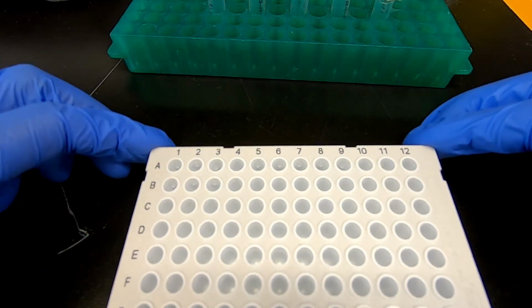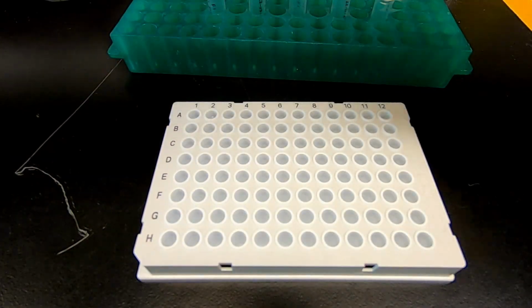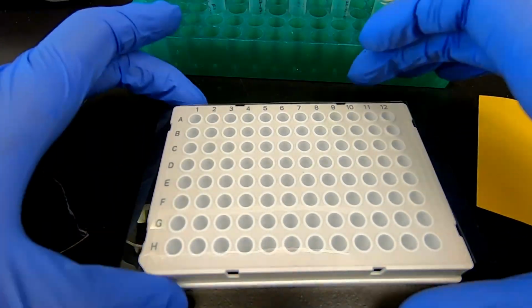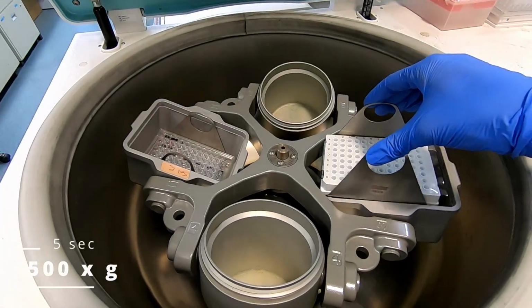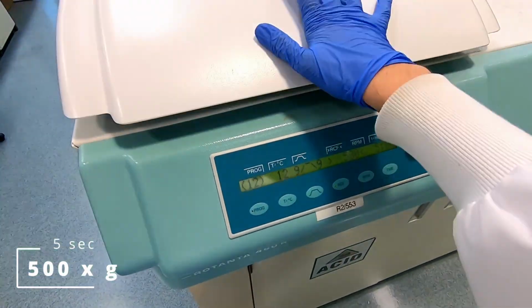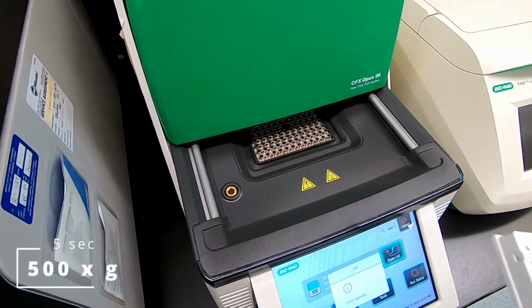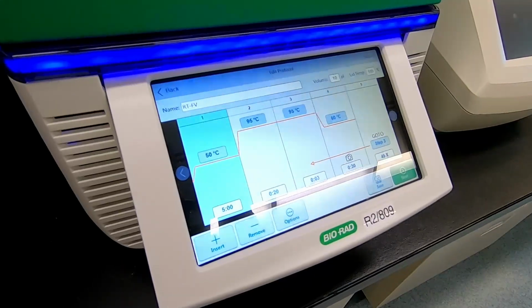Lightly tap the plate on the bench to collect droplets at the bottom and seal the plate. Give the sealed plate a quick spin to ensure all the reaction volume is mixed in the bottom of each well. Load the plate into the thermocycler with the proper protocol and wait for the plate to be read.